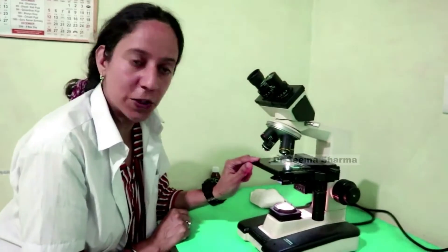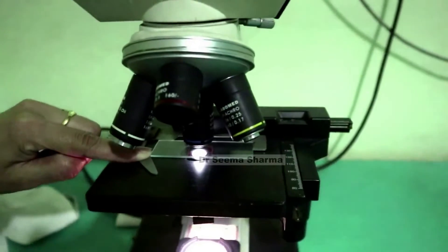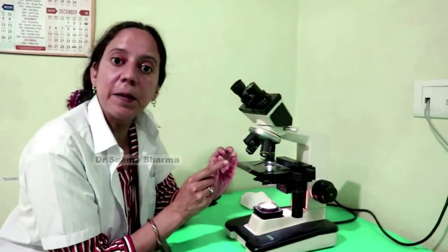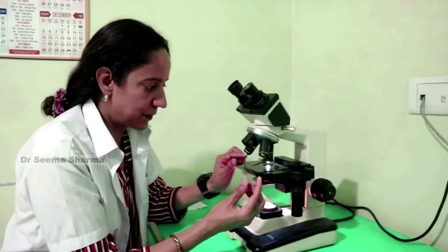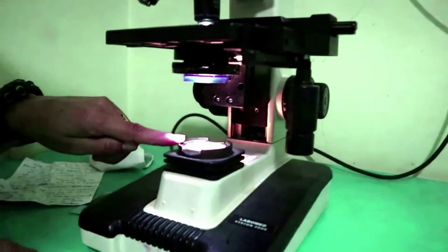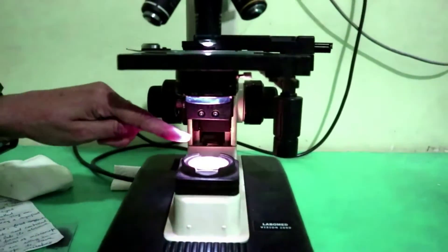Next, we have the stage. Specimen is kept on this glass slide on this stage. Let's have a look at one prepared slide. This is a glass slide on which we keep the microscopic object in one drop of water or colored solution, and observe it by placing it on the stage and adjusting the light. The source of light is present at the base of the microscope to illuminate the specimen for better observation.